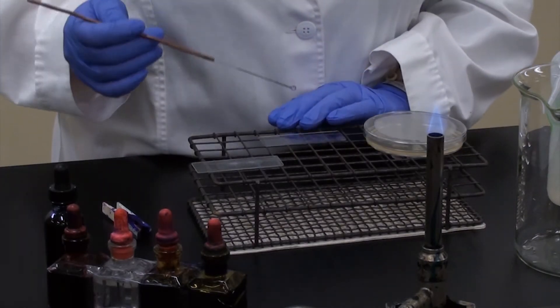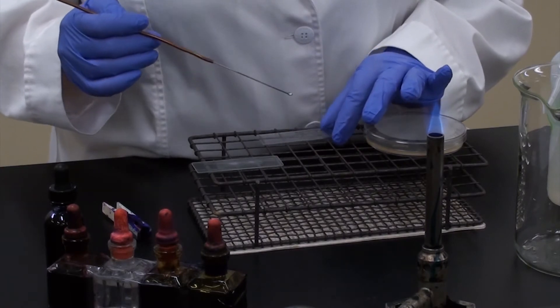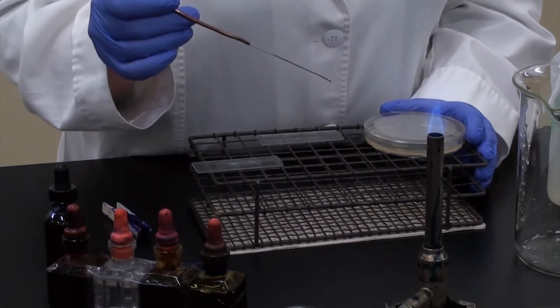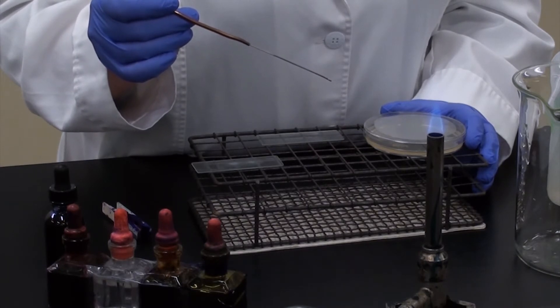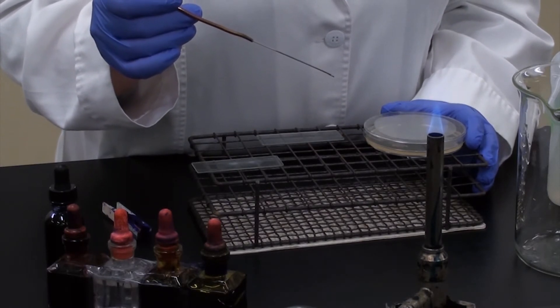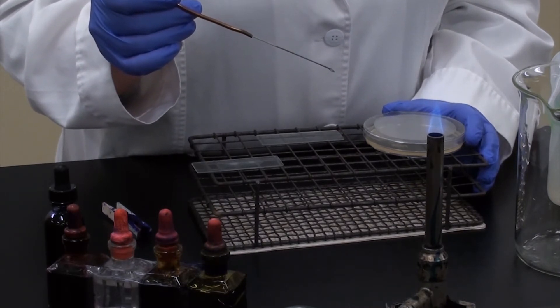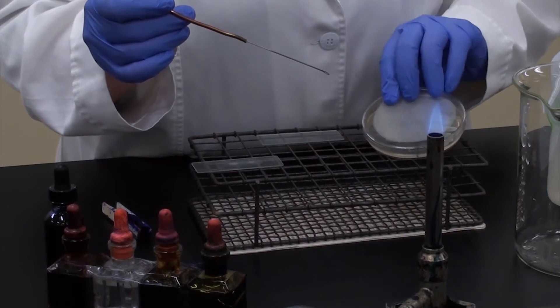I have my plain slide and I'm just going to put a drop of water in the center of the slide and sort of squish it around a tiny bit. Now I'm going to reflame my loop — and again, not waving your loop around, don't get too much on it; we're just transferring from the bacteria that we want, nothing else from the environment. If you've watched other videos, you know I sing the coconut song while I'm waiting for my loop to cool.